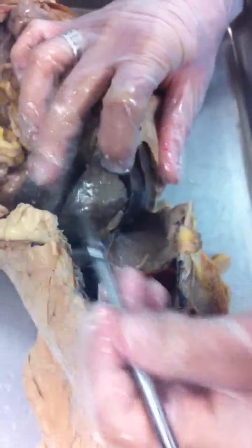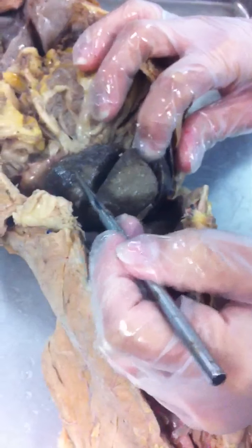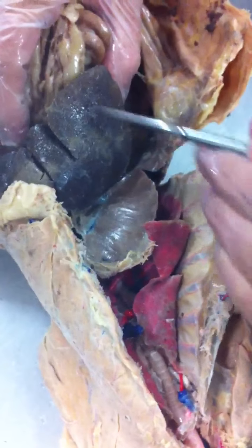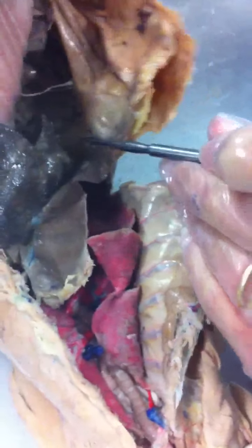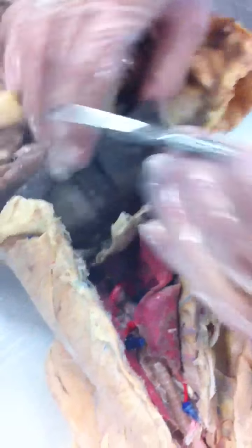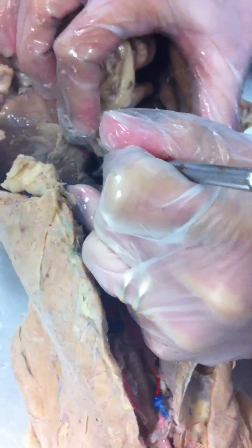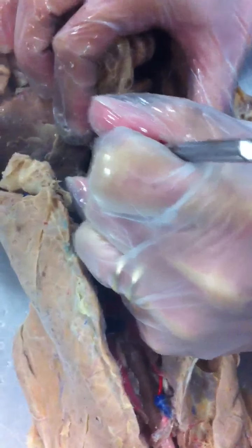So with the left side, we then have left medial and then left lateral. Come over here to the right side, this large one, right medial, and the little guys down here, right lateral. When we look in between and we break through this lesser omentum, there was one more little lobe here called the caudate lobe.